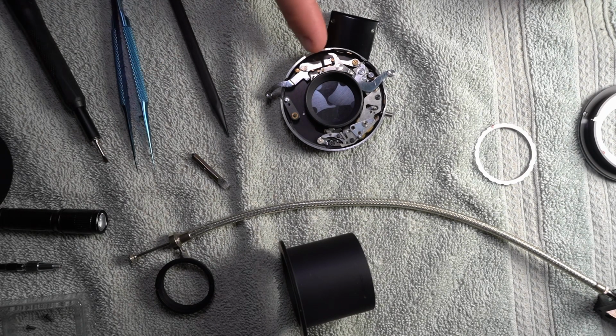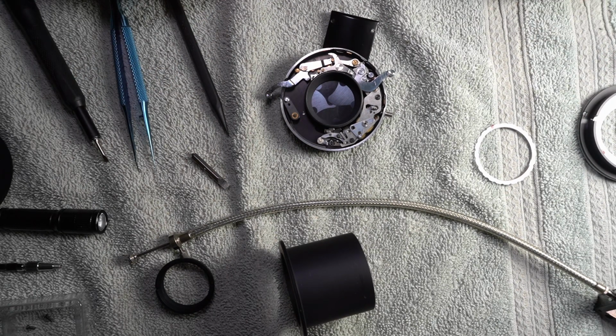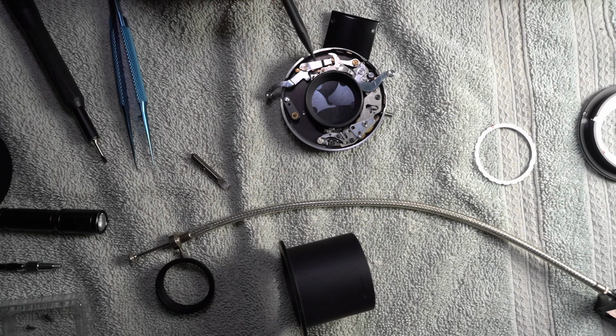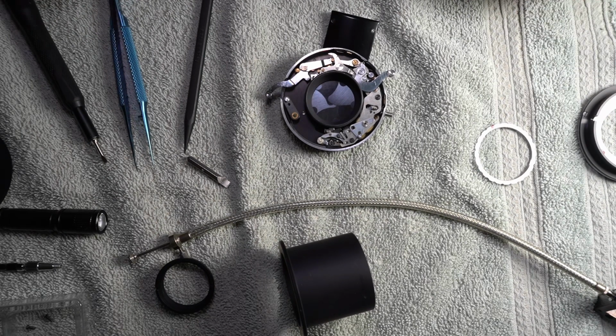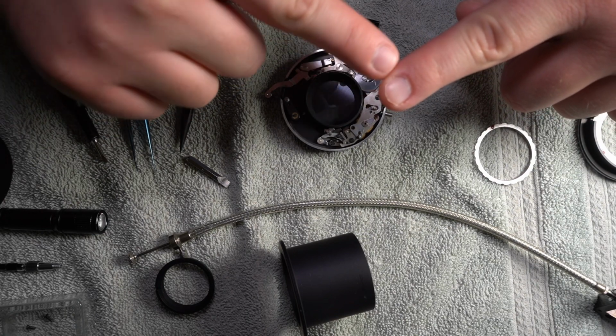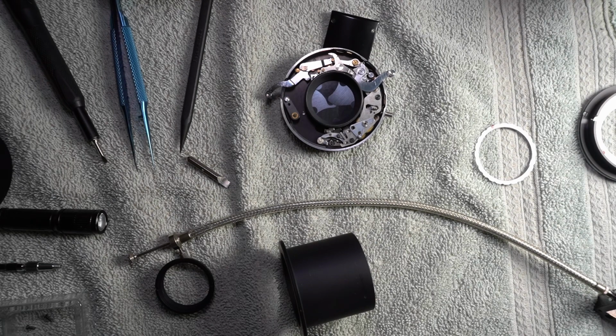Now, I'm not a professional by any means. I don't really know what I'm doing. But the whole idea behind this is to get this stuff greased. I'm trying to put the smallest amount of grease on this I can. It's literally like a 32nd of an inch thick pieces of metal on these arms. I'm putting the smallest amount of white lithium grease I can on these, because I just want it on the side of it where it's sliding. I don't want it on the face. I don't want it on the bottom. I don't want it dripping onto some other part of the thing, because it's not the right grease for it.